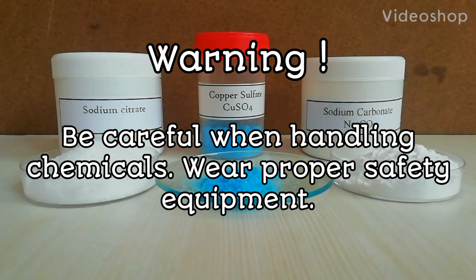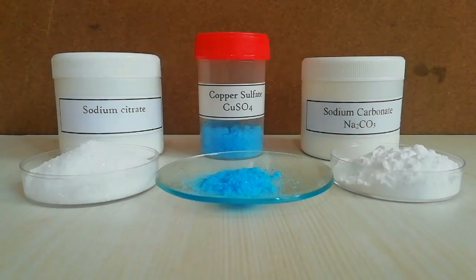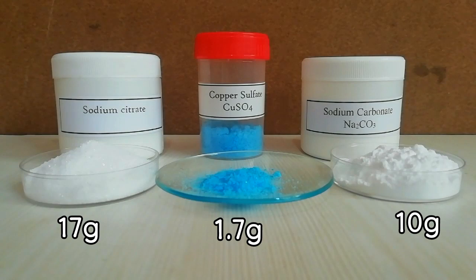Be careful when handling chemicals via proper safety equipment. For this experiment, copper sulfate, sodium citrate, and sodium carbonate is used.